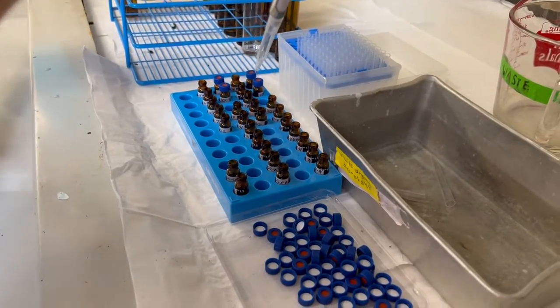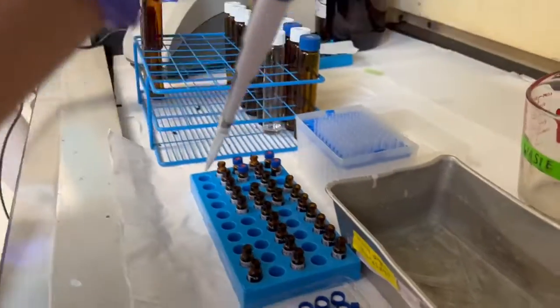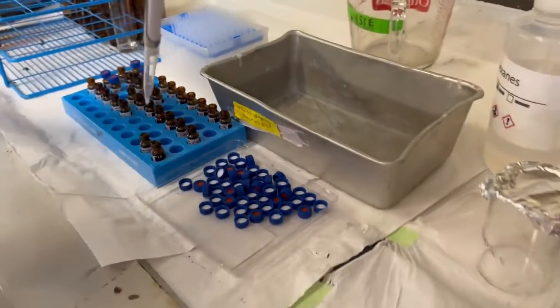Oh, you get all of them? Yeah. Okay. And then you can just put it there. And then you can cap them.